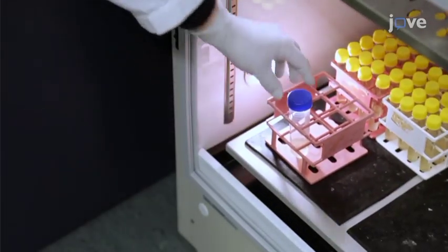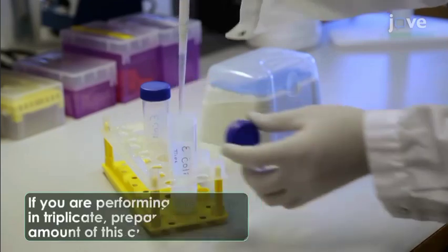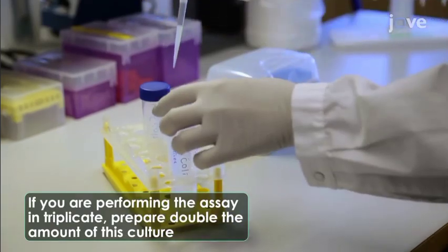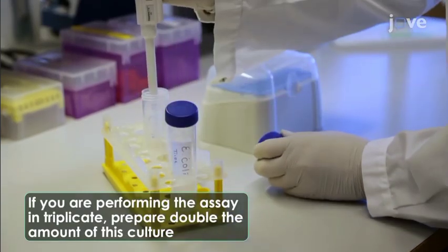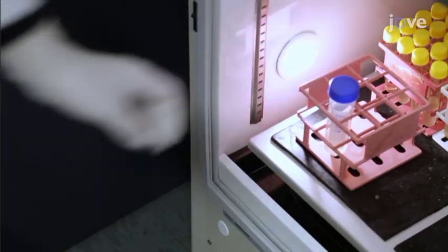Then, on the day of the assay, remove the bacterial culture from the incubator. Seed a fresh 10 milliliters of fresh LB broth with 0.5 milliliters of the overnight culture. Place these cells to grow into a shaking incubator set to 37 degrees Celsius at 160 RPM.